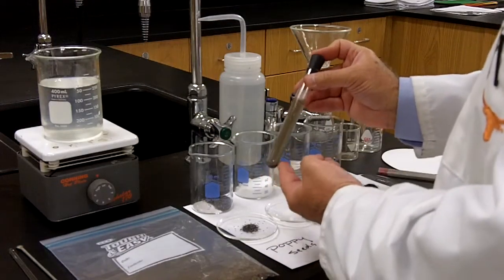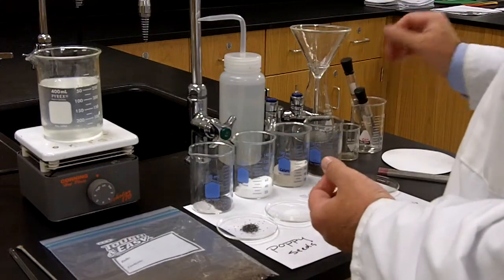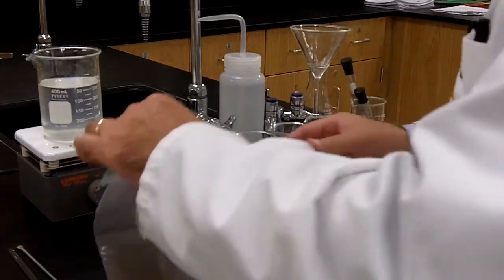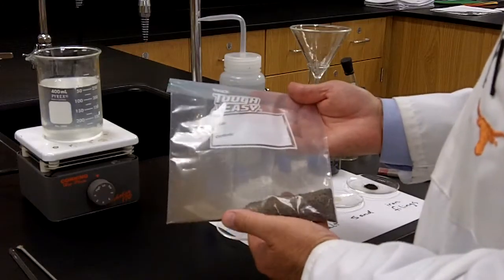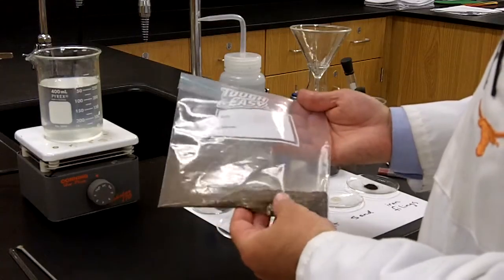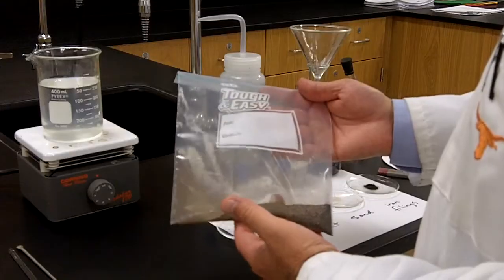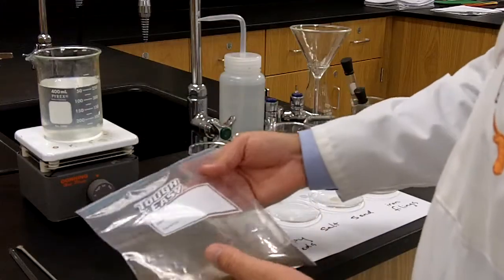So now that we're clear on the difference between homogeneous mixtures and heterogeneous mixtures, let's talk a little bit about how we might separate a mixture. Remember that mixtures can be separated by physical means, not by chemical means. So what's the objective for today? Well, the objective is to take the contents of the bag at your laboratory desk, filled with some granulated material. You don't know exactly what it is at this point, but it's a small sandy looking material, and it is composed of four things. I'll talk about those in just a little while. Your job today is to separate those four substances. In other words, you're going to do a physical separation today.